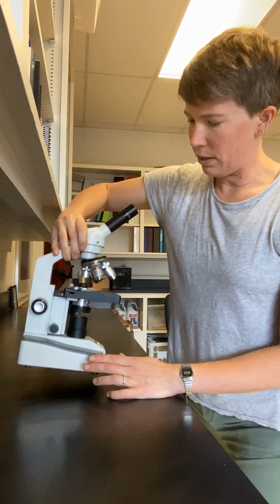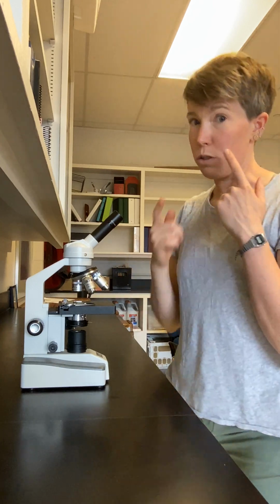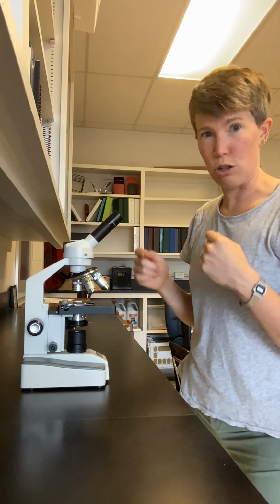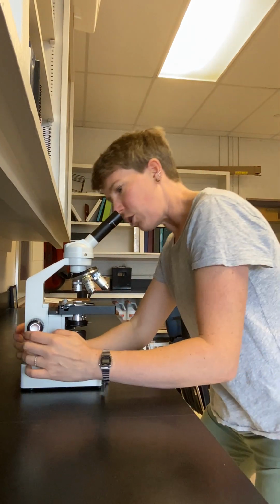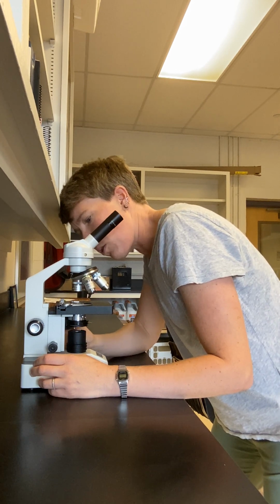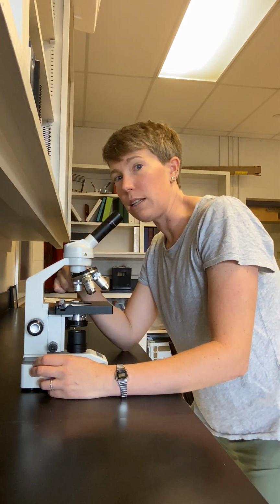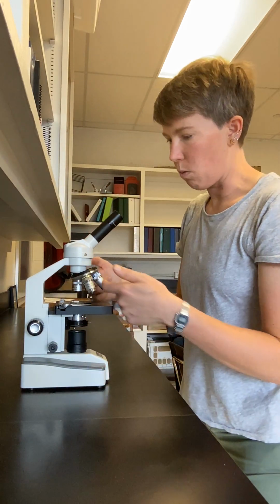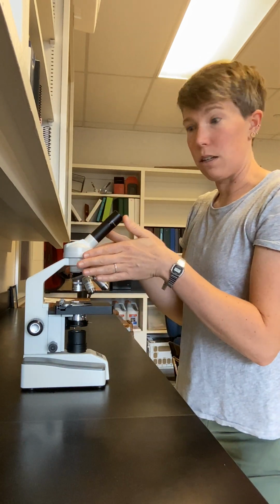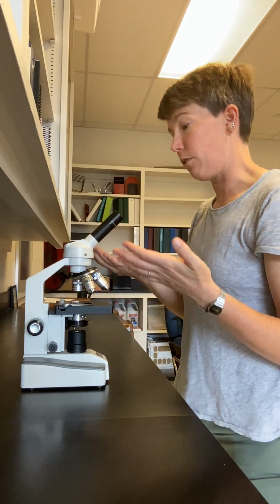So once the slide is on the stage, the light is on, the light intensity is halfway up, you are going to use your naked eye. This means not looking through the microscope, just eyes directly looking down at the sample. You are going to use the orientation knobs to get your sample, so for me it's the letter E, directly over the light source. So this tells me when I see my sample right over the light source, I know that it's centered in the field of view. And now I'm finally ready to bring the sample into focus.